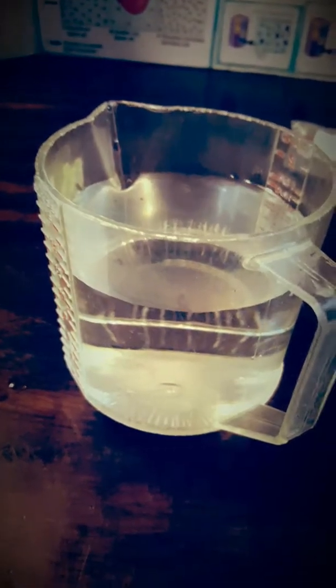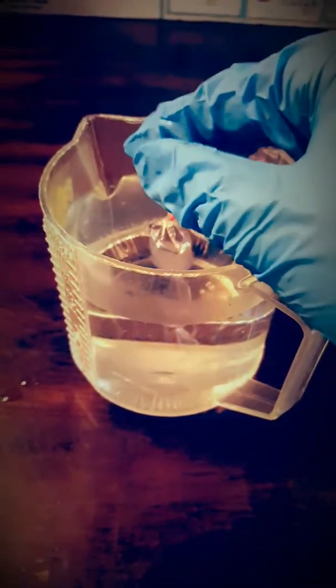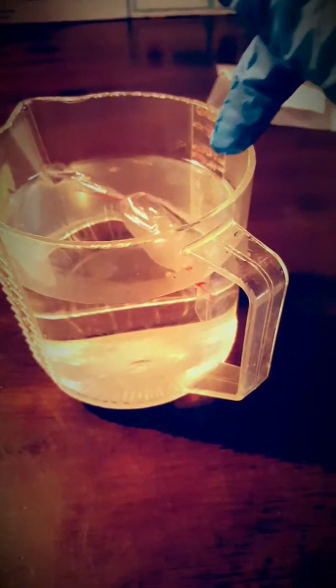Okay, so as you can see, we have our water beaker container right here now. And here is our little bag of the 20% glucose solution. Basically, what's going to happen with all of these solutions and bags that we're going to make is we're going to put them into the container, wait about 20-30 minutes, and we're going to weigh them at the end and see what the difference is between the initial weight and the final weight. So these glucose solution bags that are put inside the beaker with just water, we expect them all to gain weight, right?